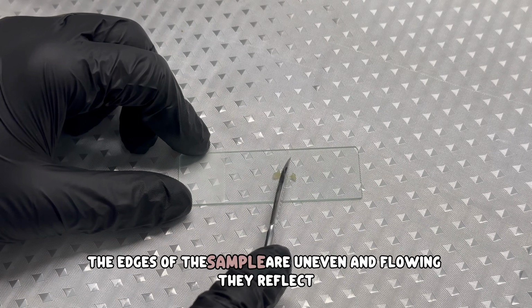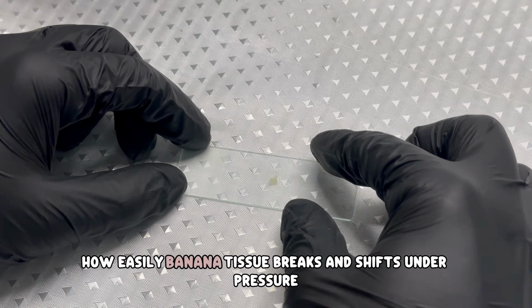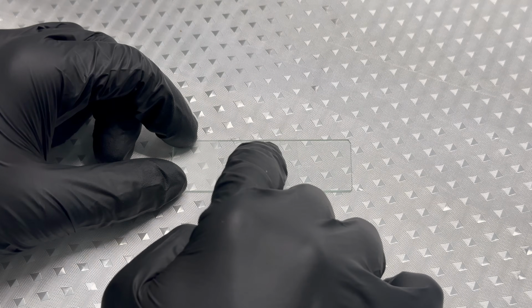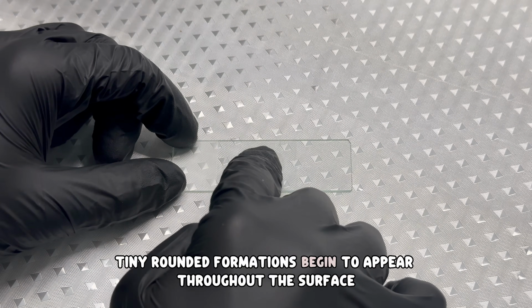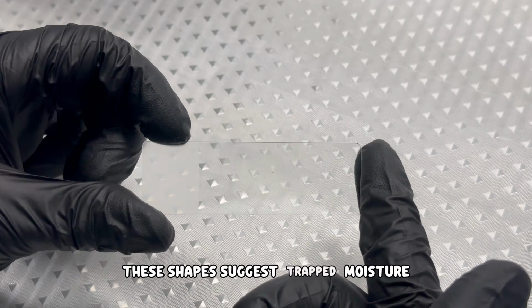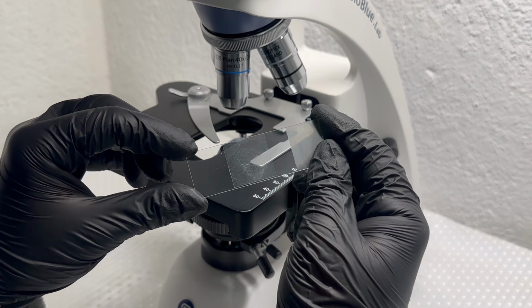The edges of the sample are uneven and flowing. They reflect how easily banana tissue breaks and shifts under pressure. Tiny rounded formations begin to appear throughout the surface. These shapes suggest trapped moisture and internal components dispersed within the fruit.